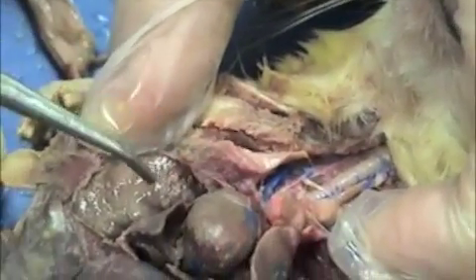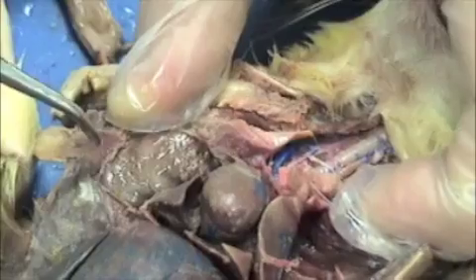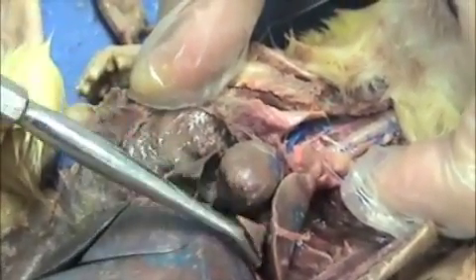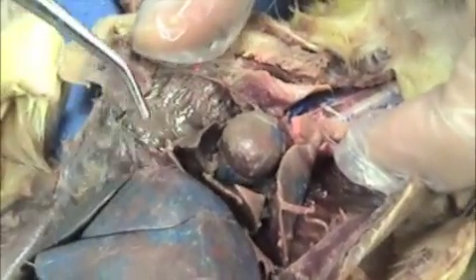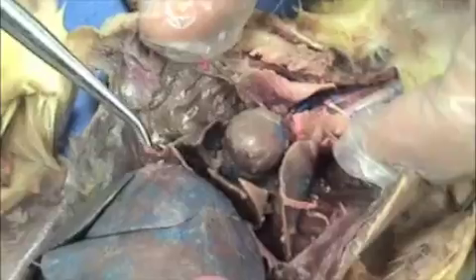You see the heart. You see the lungs. All of this is the thoracic cavity. Here is the diaphragm — it's been cut away so that you can actually open it up and see something.